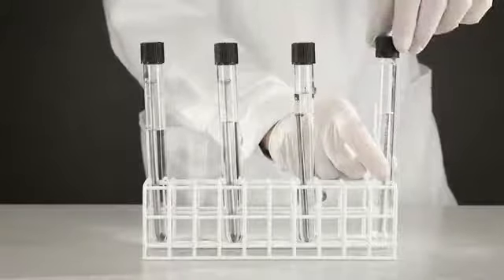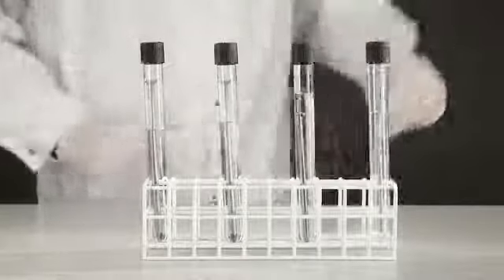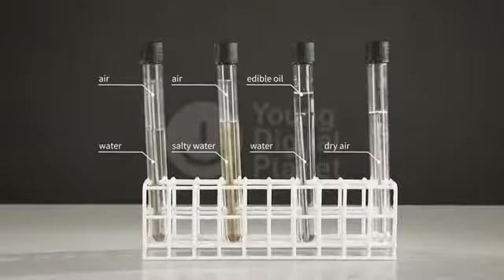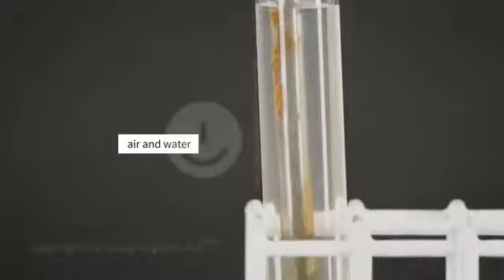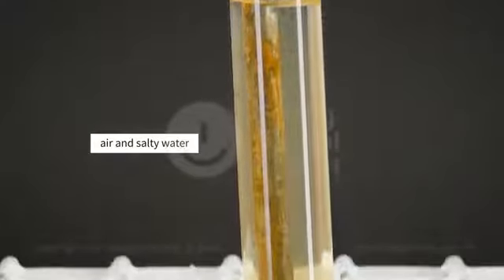We seal the test tubes with stoppers and put the rack aside for a few days. If we examine the contents of the test tubes afterwards, we'll see certain changes. In the first and second test tubes, the nails were in contact with air and water, so they become covered in rust.